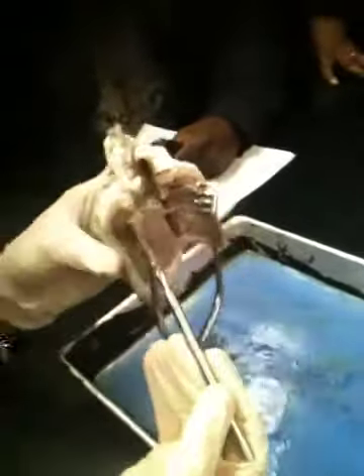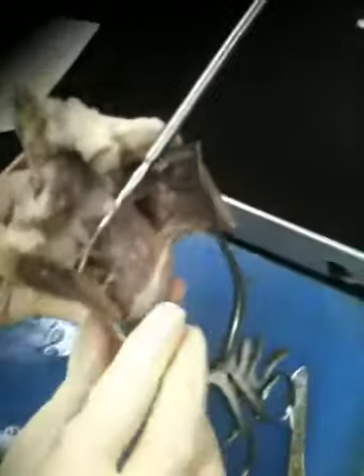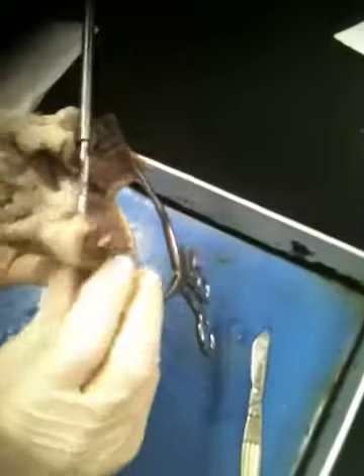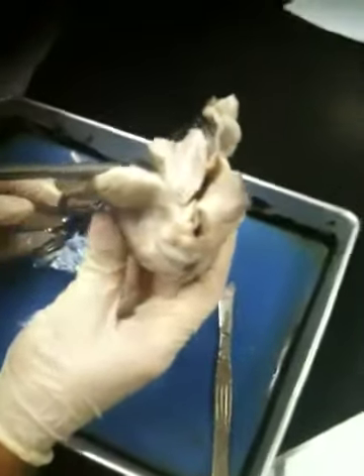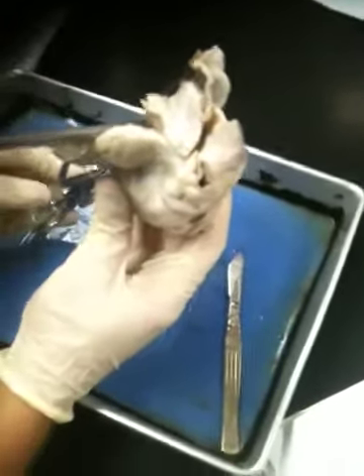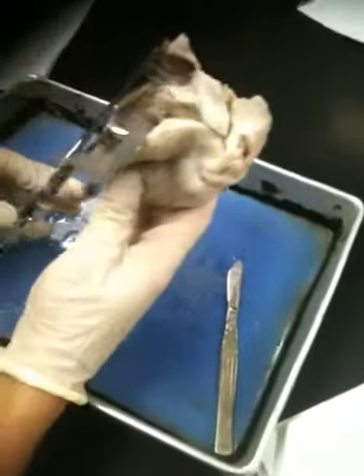Notice how what I'm lifting right now at the tip of the probe are the white flaps of tissue, which are the cusps of the valve. And I'll flip over this way. All these white tissues right here are the pieces of the valve. And of course, notice if I use the probe to push on all these little strings, what are those? The chordae tendineae. Okay, ready? Notice how right now I'm using the tip of the probe to lift up a bunch of little white strings. Those white strings here are the chordae tendineae. That separates the atrium from the ventricle?